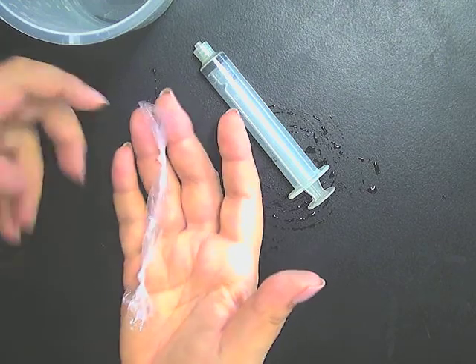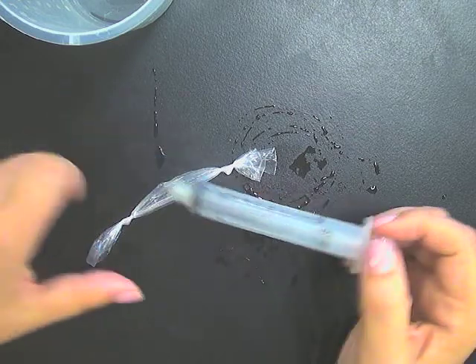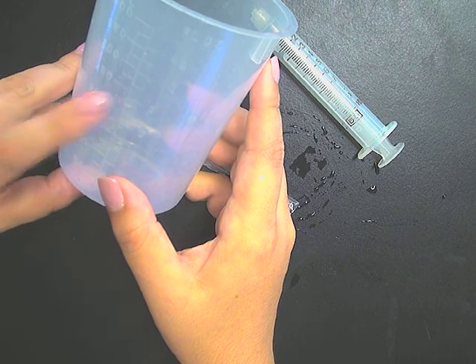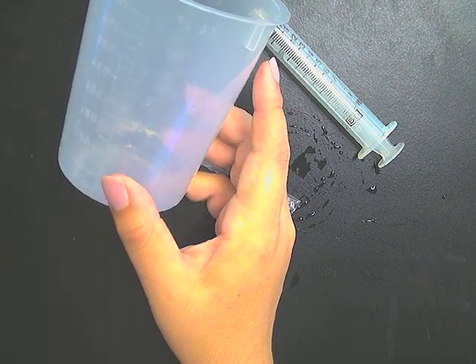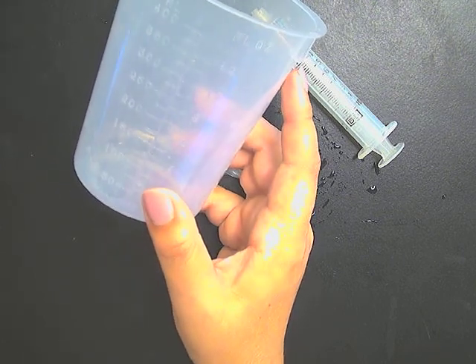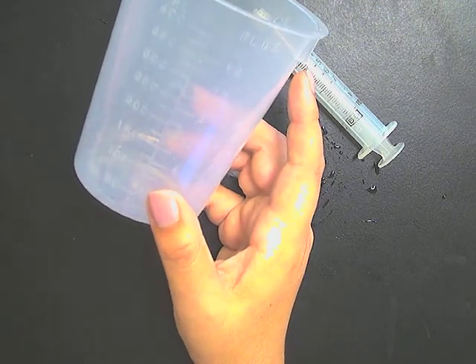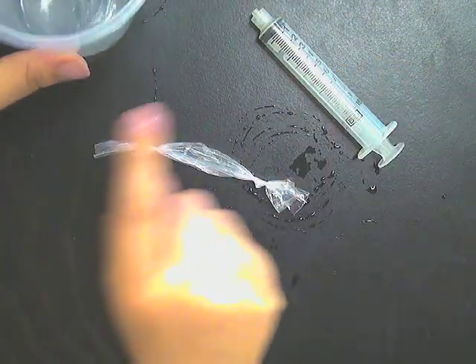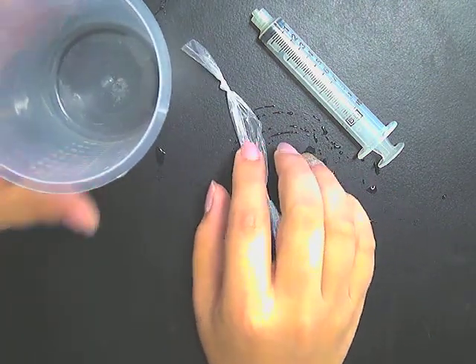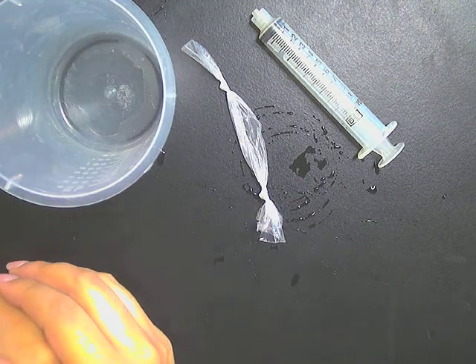Some of the things we are going to try to keep constant: everyone is going to use the same volume of solution in their sausage, the same volume of water in their beakers, and the same balance every time, so that if it's not calibrated perfectly, we're still calculating a percent change in mass. We also are going to keep our temperature the same, and use the same source of water.